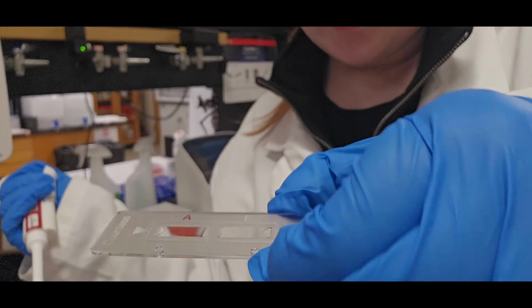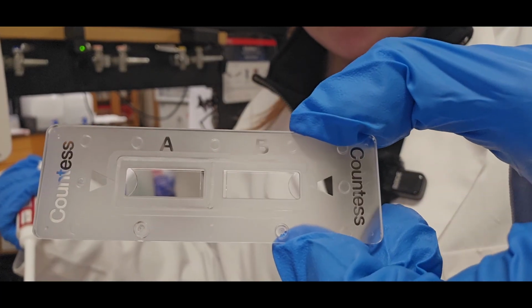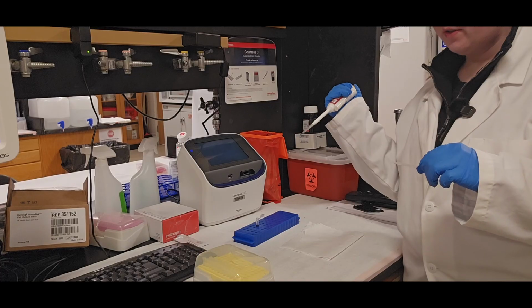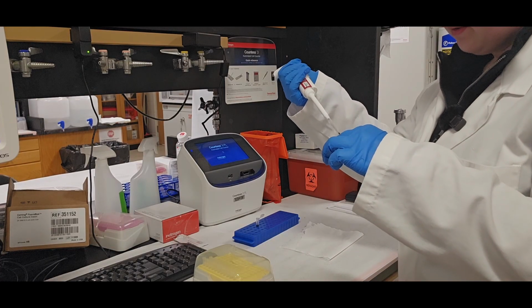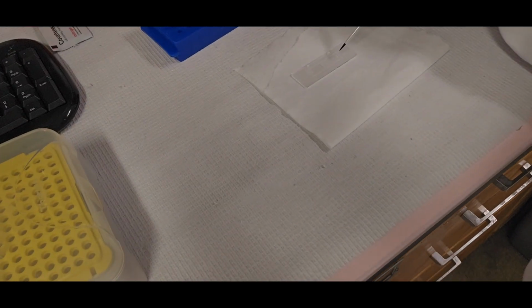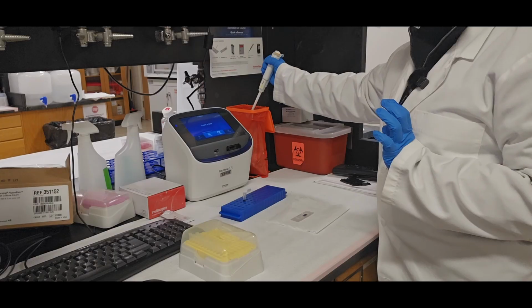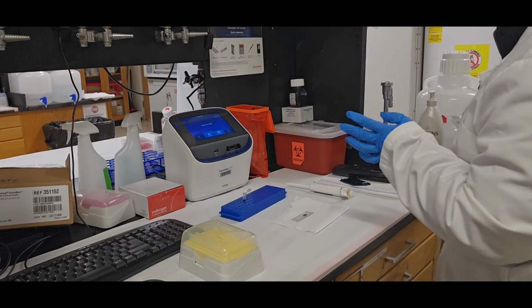And it looks pretty much just like the hemocytometer that we manually count with. There's an A and a B side, and where the arrow is pointing is where you eject the 10 microliters. Unlike the manual counter, it seems like it's okay to actually touch the tip down inside this channel. So it's a lot easier to actually pipette your sample into this. And I'll show you. So I'm just gonna pipette into one side and just do a count on that one side. This packaging can go in normal trash.